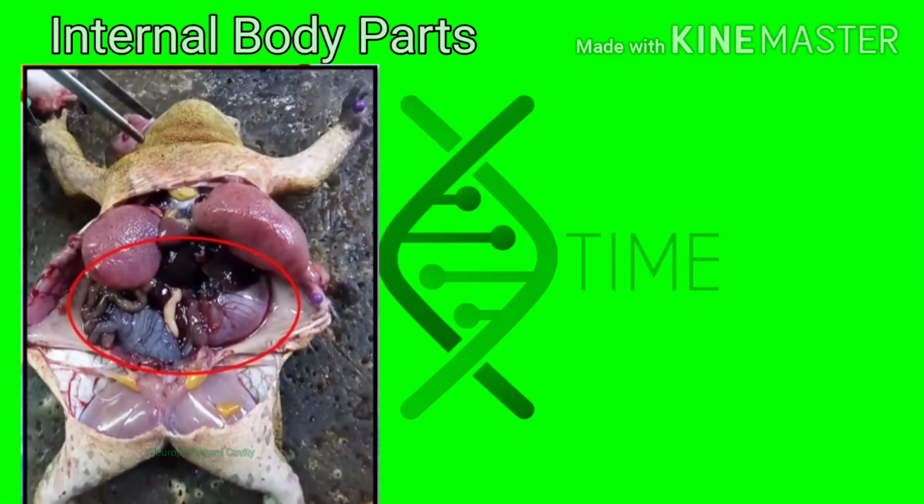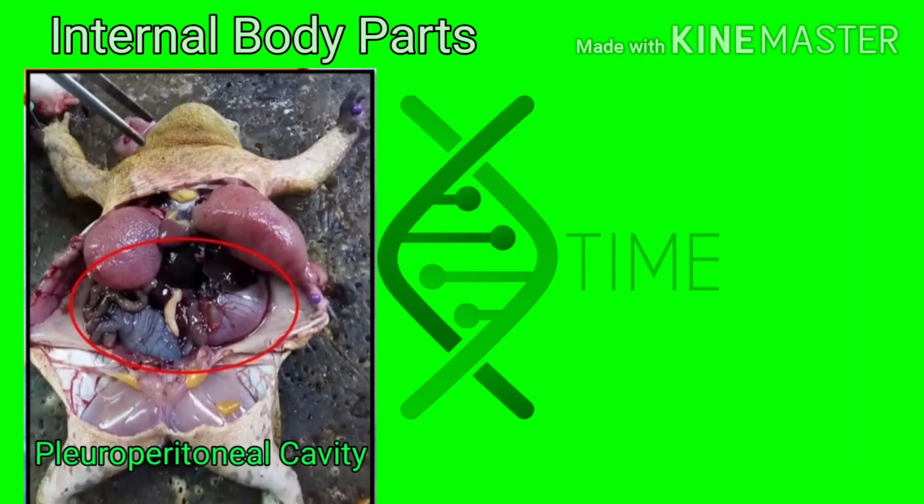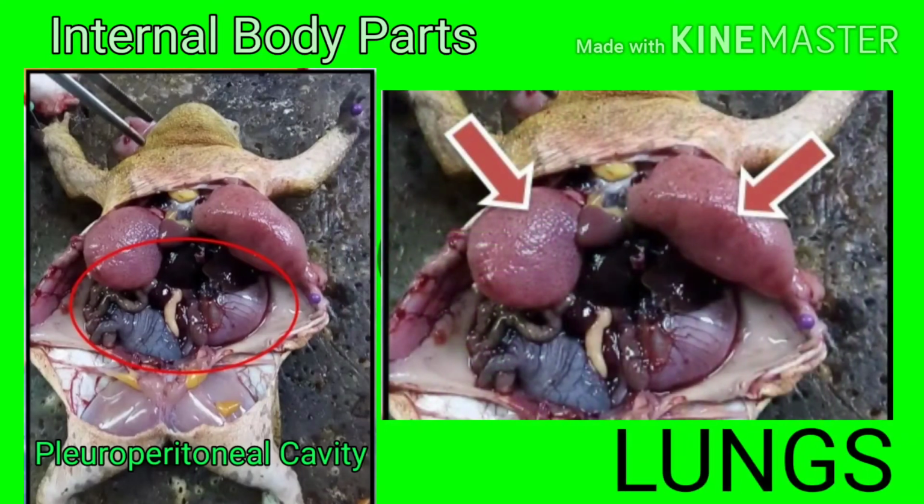While the pleuroperitoneal cavity is the cavity that occupies a greater part of the space in the trunk, which holds most of the visceral organs such as the stomach, intestine, liver, pancreas, lungs, reproductive organs, spleen, and other less conspicuous organs. Let's start off with the lungs. They are paired organs for breathing, and they have thin-walled sacs that can be seen inflated or collapsed.